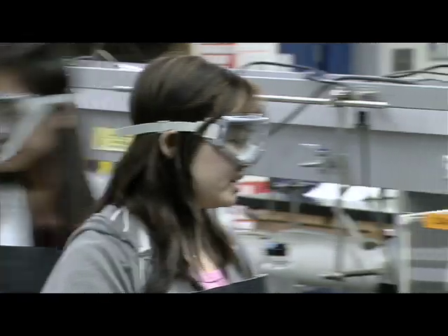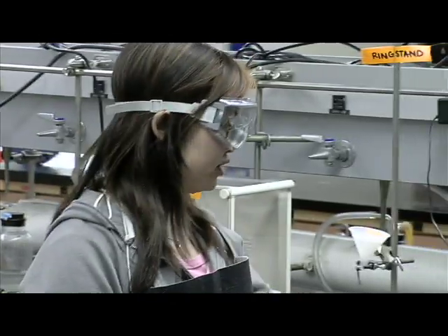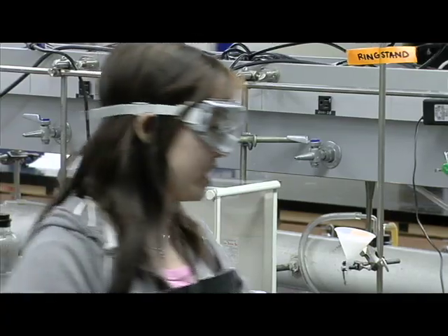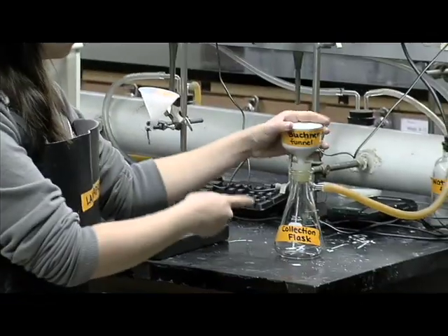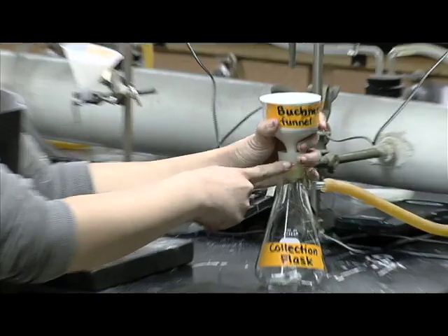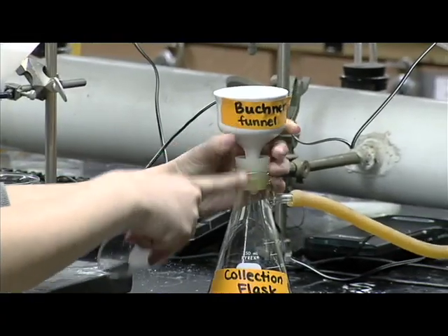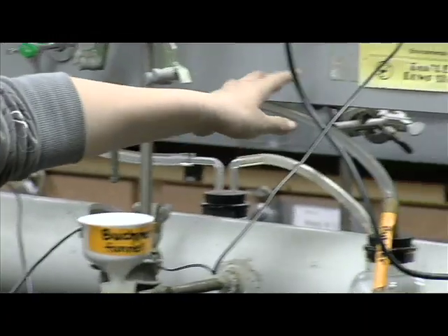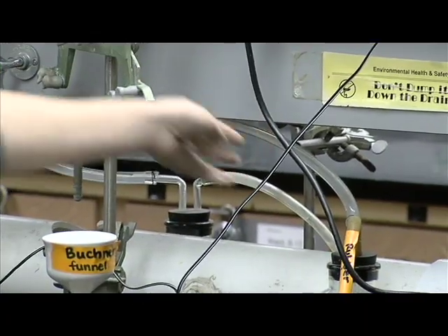Another type of filtration is called vacuum or suction filtration. For that type of filtration, you need a collection flask, a Büchner funnel, a rubber stopper, rubber tubing, a water trap flask, and a vacuum, which you use from the lab bench.